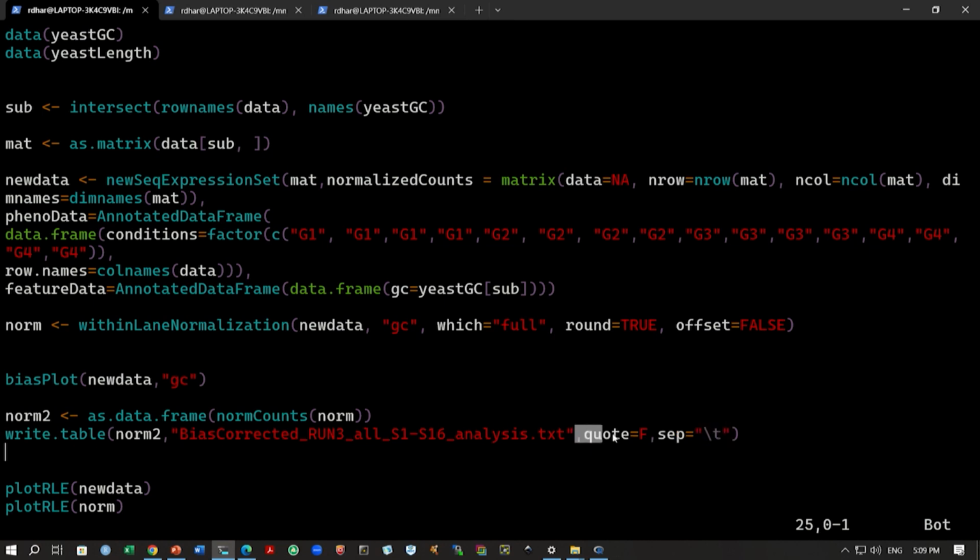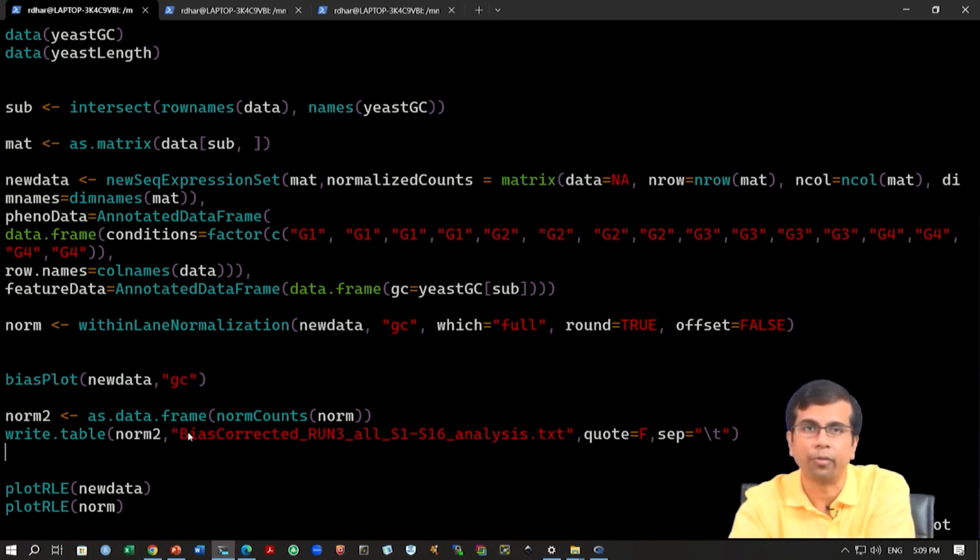Quote means f. If you do not use this argument, all these values will be within double quotes, and we do not want those double quotes. So, we will write quote equals false. F just stands for false. Instead of writing the full thing, we can simply say f, and it means we do not want any quotes when we are writing this data. Okay, so we will run this.